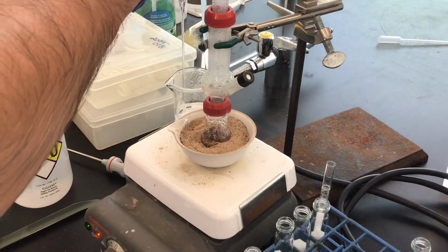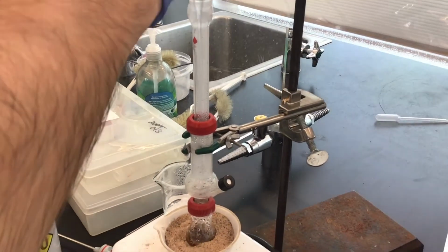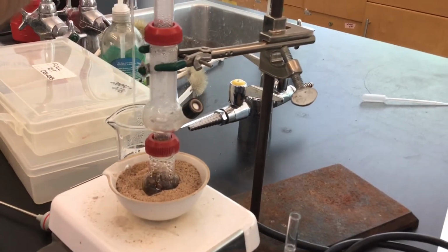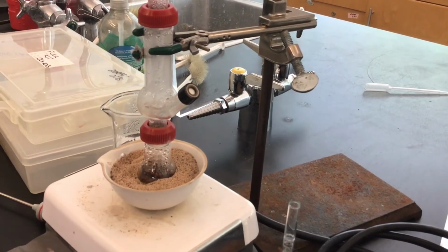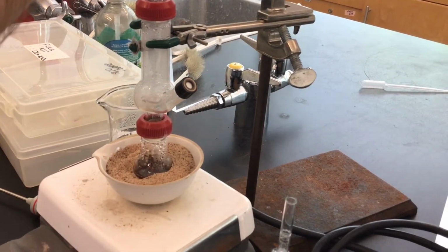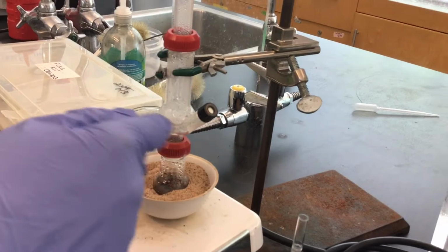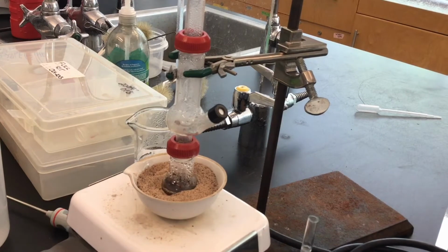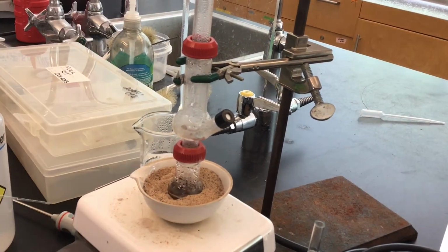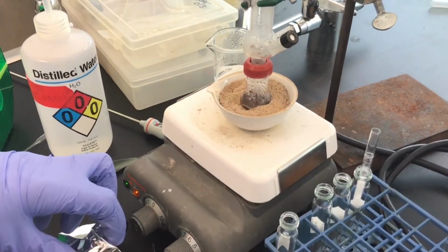So I have some water on the side, and I'm going to dive down very carefully, and I'm adding more water to the distillation head. Excuse me, to the distillation pot. So my Pasteur pipette is bypassing this, so I'm making sure that I'm not adding water to the area in which we're actually hoping to collect the distillate. And I'm going to reserve this Pasteur pipette in order to do that, and this one in order to collect distillate. But right now, this rate at which it's going is pretty good.